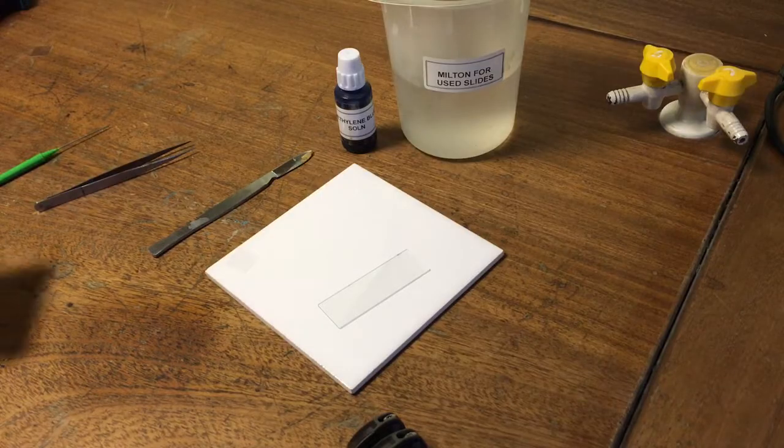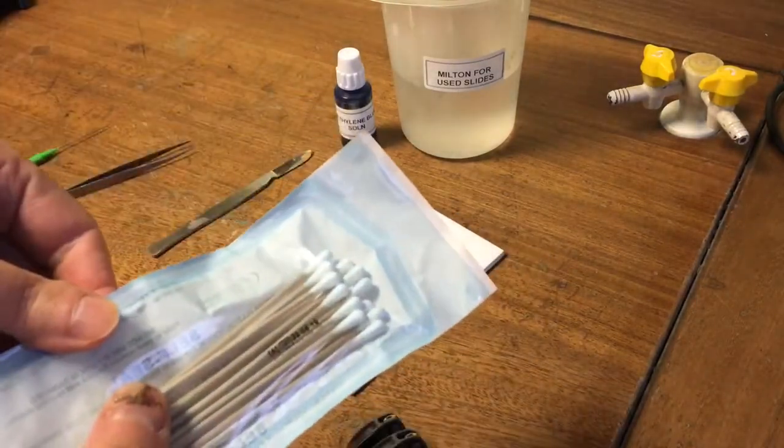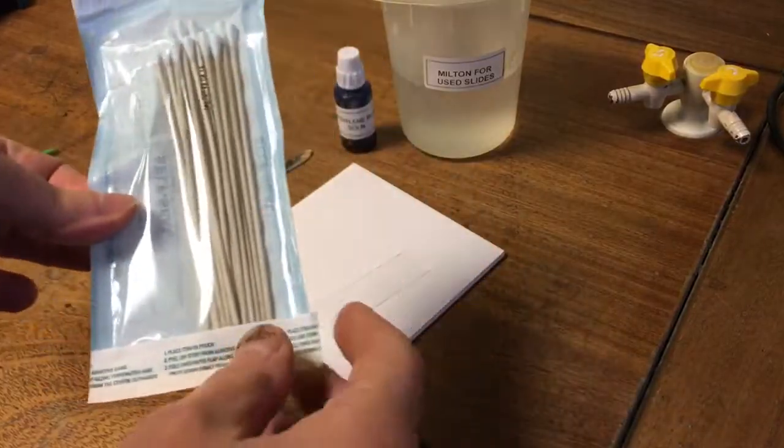Now I'm going to prepare a slide of some human cheek cells. I'm using these cotton swabs which are sealed in a sterile container.